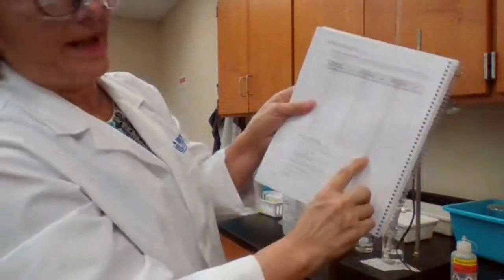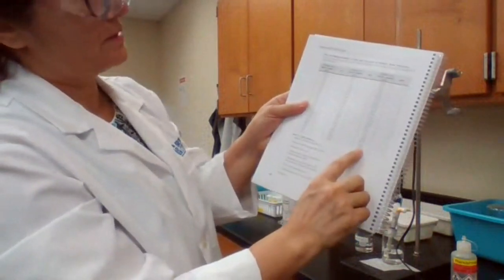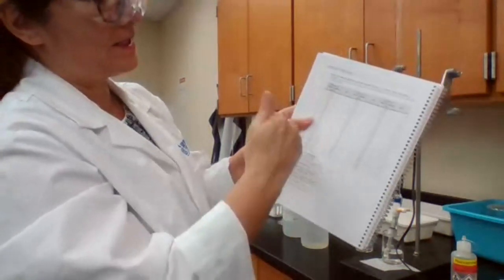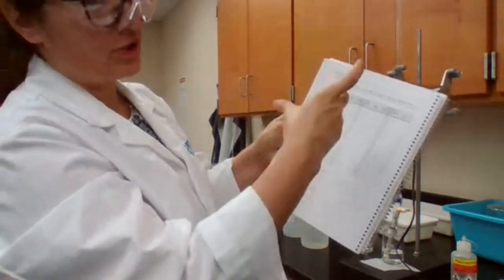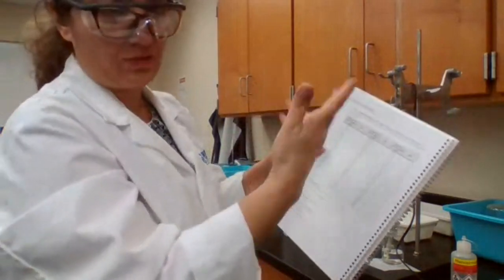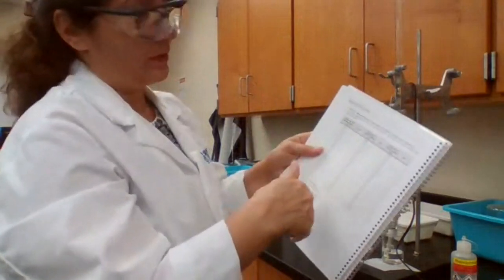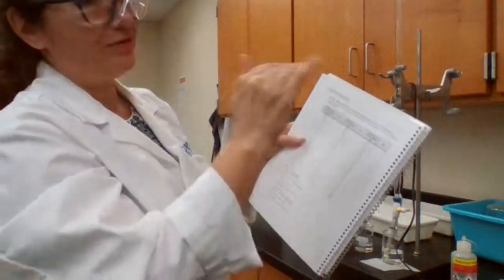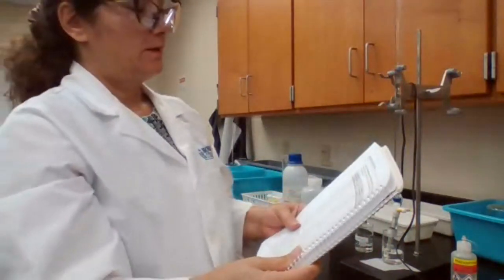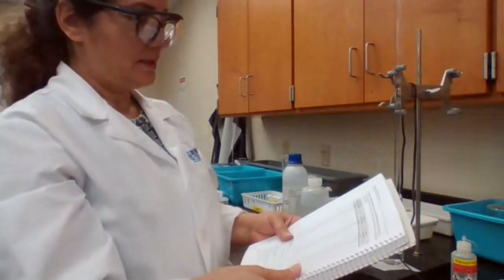I may not add the 29 milliliters. I'm going to stop after I add and see the increase in pH, then see a big jump. When I say big jump, it would be more than 1 unit of pH change. So if it goes from 6 to 8, or 7 to 9, or 8 to 10, whatever, then I will stop. After that, I continue with 4 more readings. I'm trying to see how it's going to make recording easier for me, but let's see.